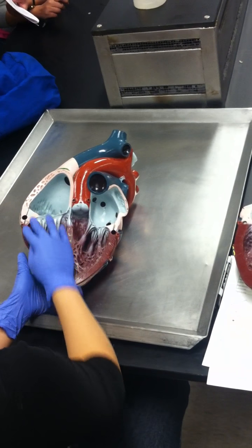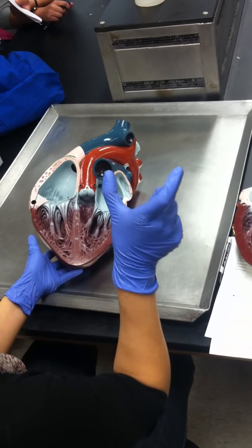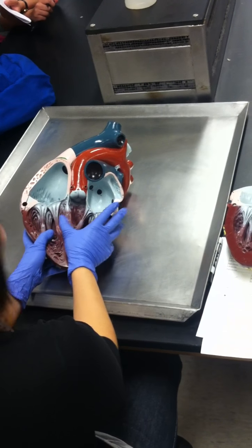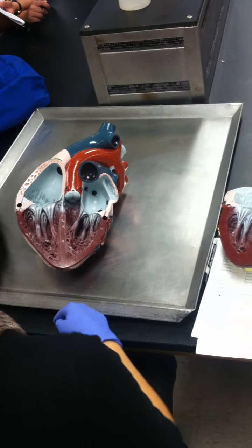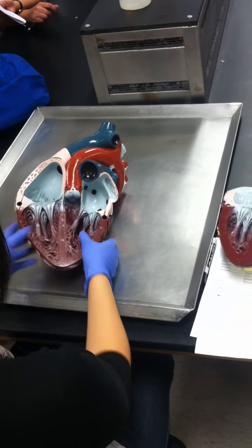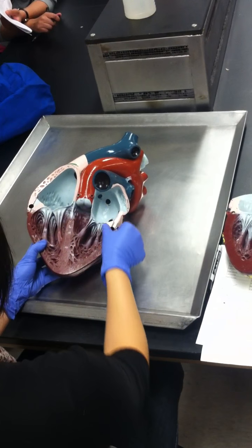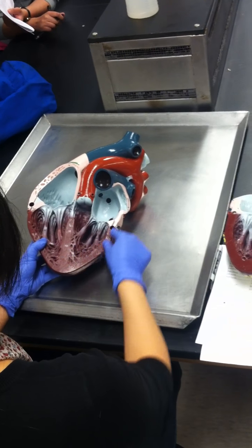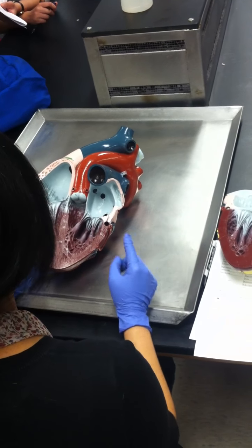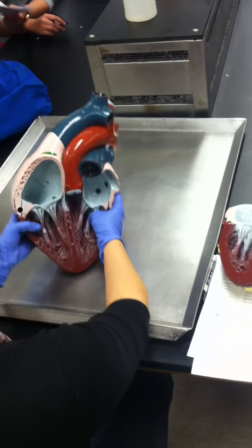But the right ventricle pumps blood to where? To the lungs, and it's like this distance, right? It doesn't need that strong of a contraction versus the contraction that's needed to push blood all the way down to the tips of your toes. So you need that thick of a structure in the left ventricle. That's how you can see which side is which. If you open up a heart and you're wondering what side this is, you look for the muscles of the ventricles. The thicker one must be the left, the one right before going to the rest of the body. Very good.